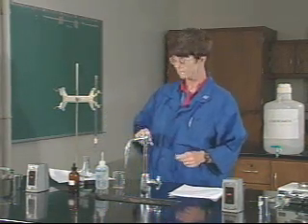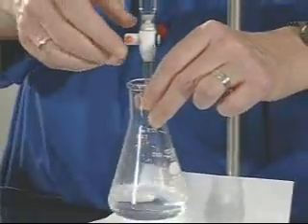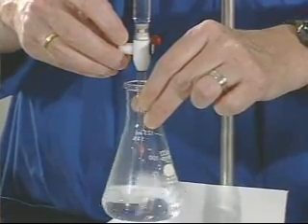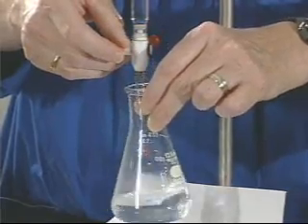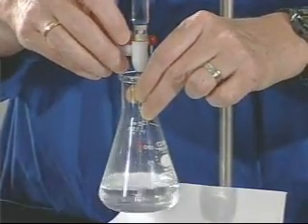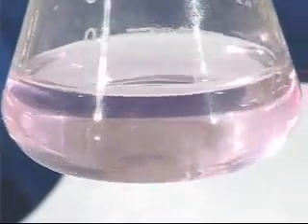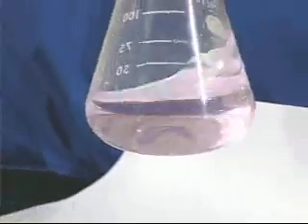Don't forget to record your initial reading. Once you've recorded it and prepared the sample, begin the titration. Admit the sodium hydroxide with the stopcock with one hand and use the other hand to swirl the solution. At first, you'll be able to add the sodium hydroxide pretty quickly. You'll see a little bit of a pink color when you add the sodium hydroxide, but as you swirl the flask, the pink color goes away. The more sodium hydroxide you add, the slower the pink color will go away. Eventually, you'll reach a point where the pink color, despite the swirling, stays — at this point you've reached the end point of the titration. This means you've added an equivalent amount of sodium hydroxide to the amount of acid in the flask. The end point is a very pale pink color.